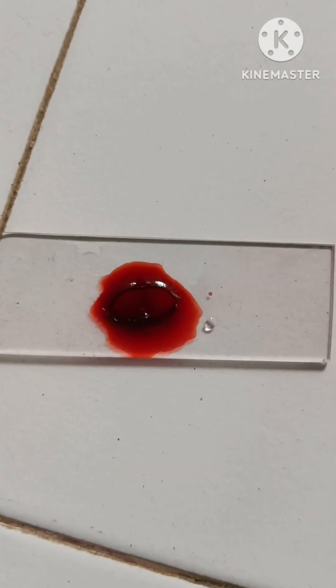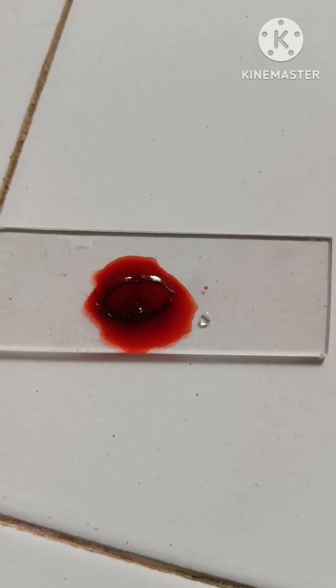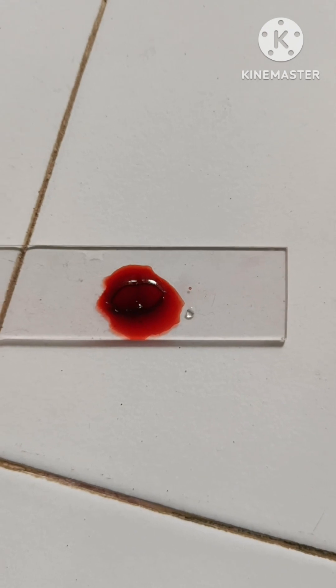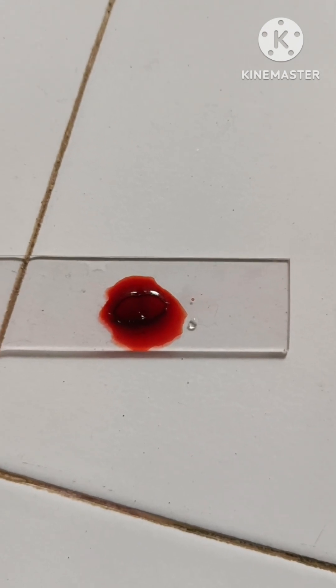So that's why, with the help of a brush, slowly spread the stain upon the cutting. Can you see, this is the cutting we have taken — it has been stained fully. Now we can clean the safranin with the help of water, and then we can observe under the microscope.